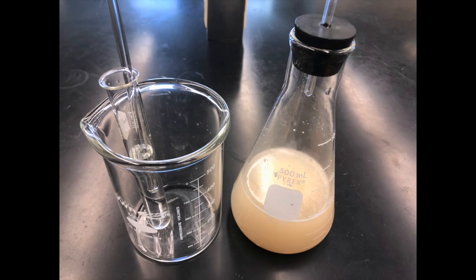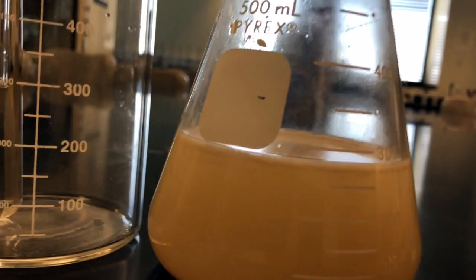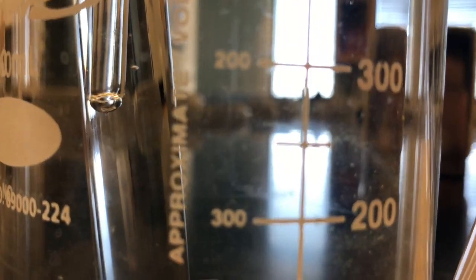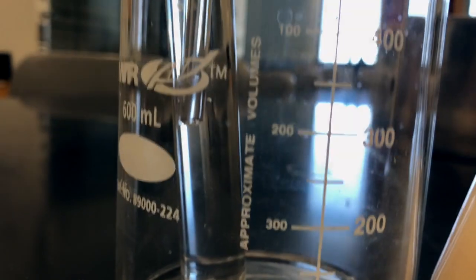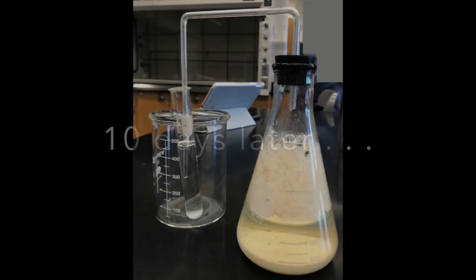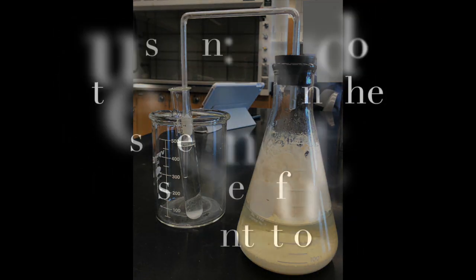This is the solution right after everything was sealed in and within an hour the bubbling had begun. The video is sped up just a bit to exaggerate how fast the bubbles were forming. Even within an hour you can see that carbon dioxide is starting to be formed. The solution is also starting to get a little bit foamy from all of the gas that is being produced. Letting this sit for about 10 days and after that time the fermentation is complete, no further bubbling is seen.